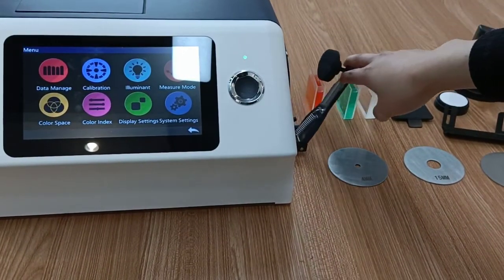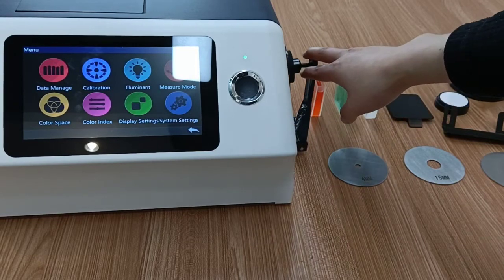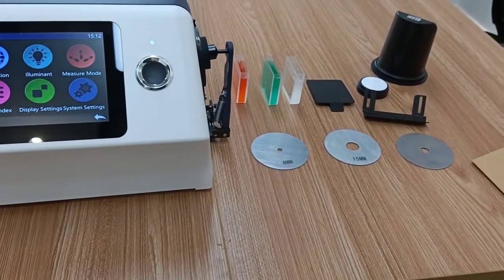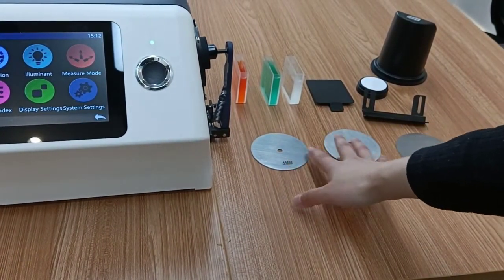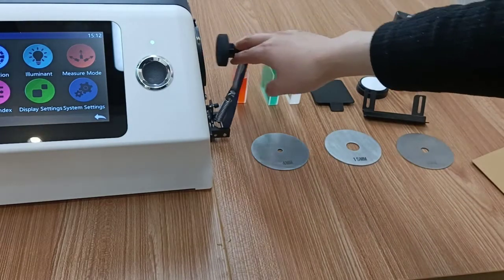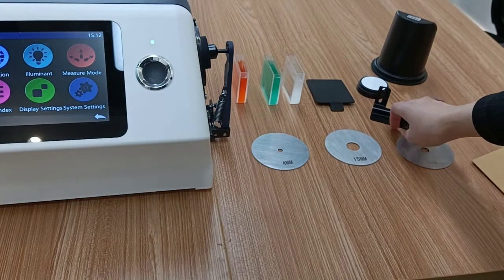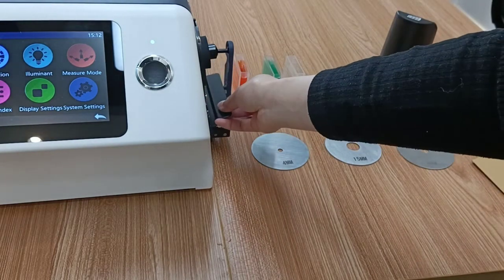Here is the reflection measurement position. These are four measuring apertures of different sizes, and another one is at here. This is a sample holder — you can place it here.